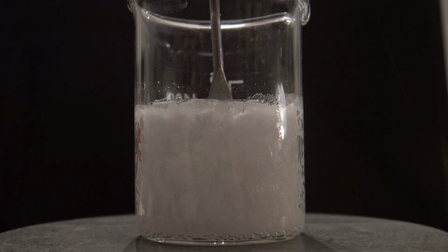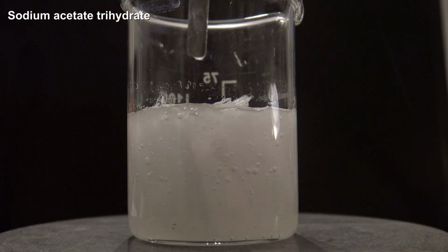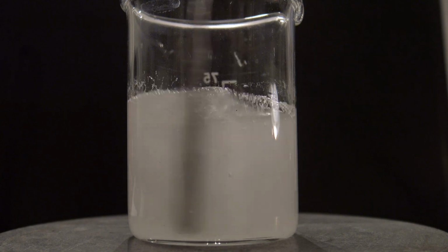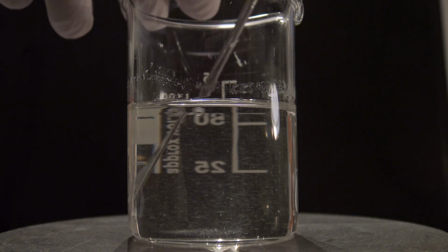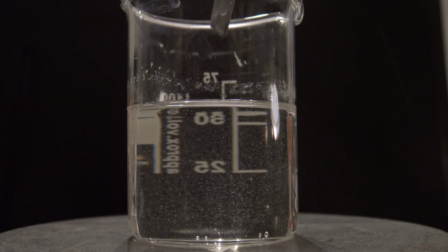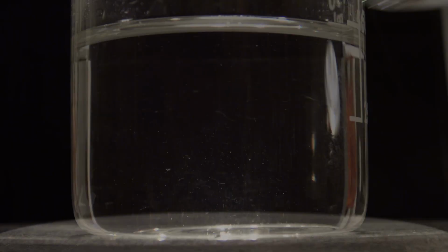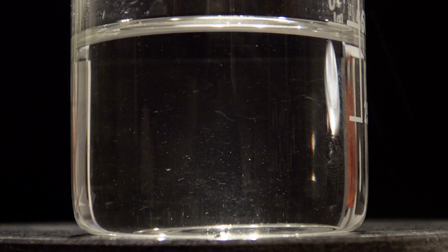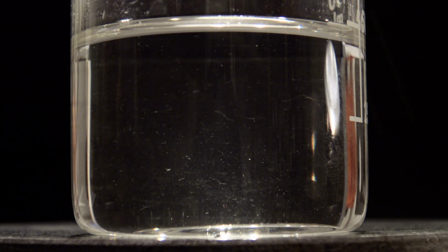For this, some sodium acetate trihydrate was heated with a very small amount of distilled water to replace evaporating water. When all of the crystals had dissolved, the beaker was covered and set aside. When this solution cools down, it often forms a supersaturated solution due to the lack of seed crystals. This is a metastable state, so movement, dust particles or the addition of seed crystals can cause the crystallization to take place.